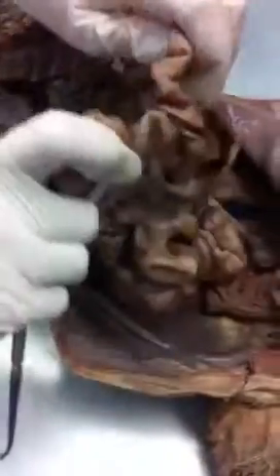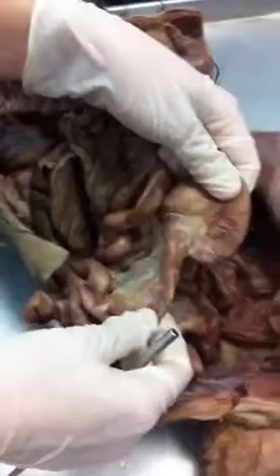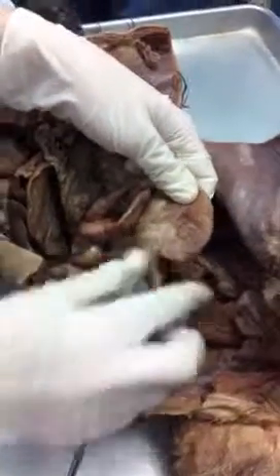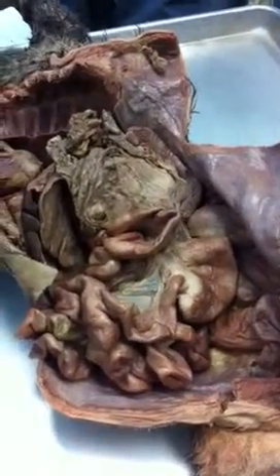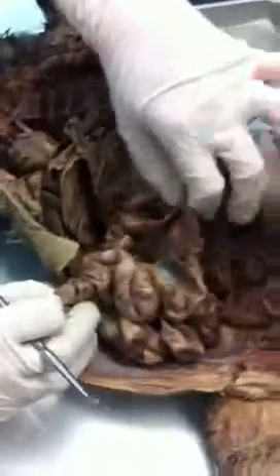Okay. What is holding together all these intestines here? These windows. What are these windows? Mesenteries. Okay. So this is all the small intestines, the jejunum, and then what are we looking for? The ileum. Coming here. Everybody see the ileum? How can you tell the difference between the ileum and the jejunum? The ileum is the one closest. So there are specific lengths in humans, like so-and-so feet are the duodenum and so-and-so feet are the jejunum. For our particular purposes, the ones closest to the stomach is the duodenum. The ones closest to the large intestine is the ileum, and everything else in the middle is the jejunum.